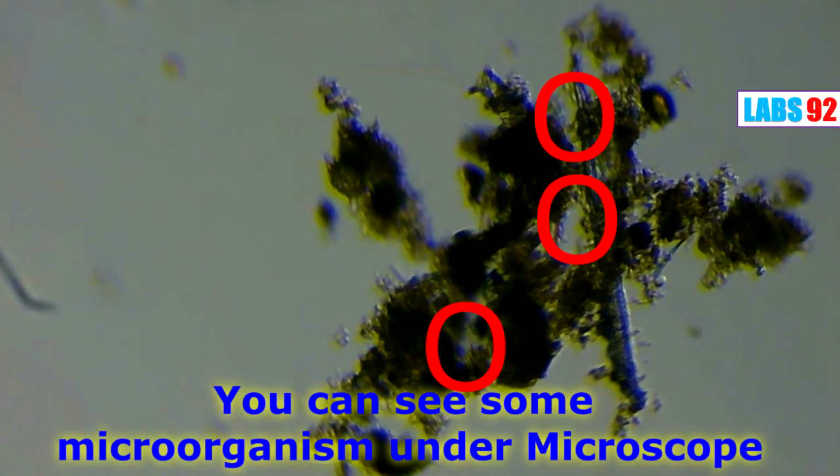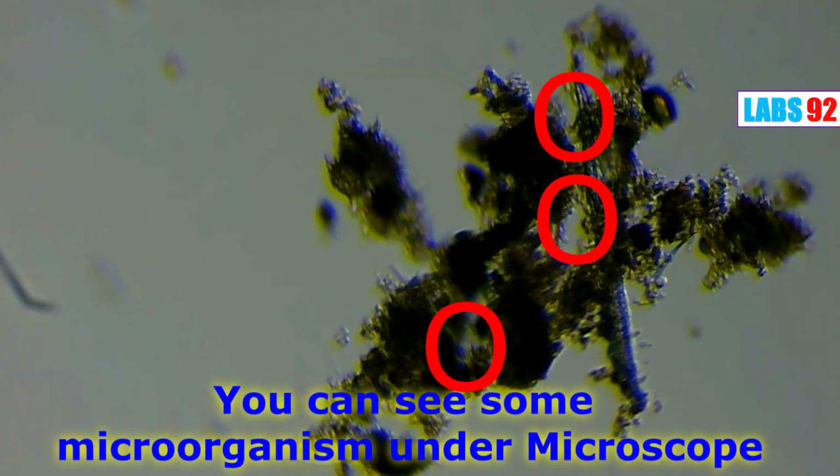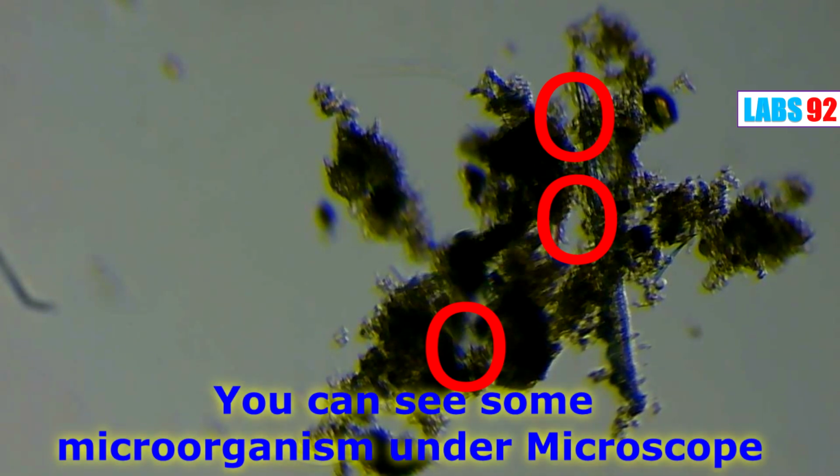Firstly, you do not see lots of microorganisms because we clean the pool every day. But when we look closely at this piece of waste, there are many microorganisms moving, shaking.